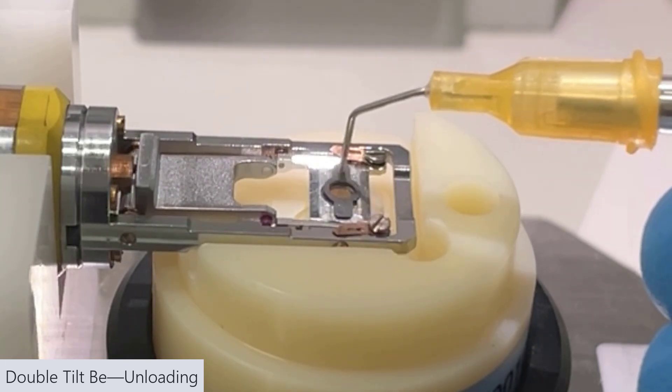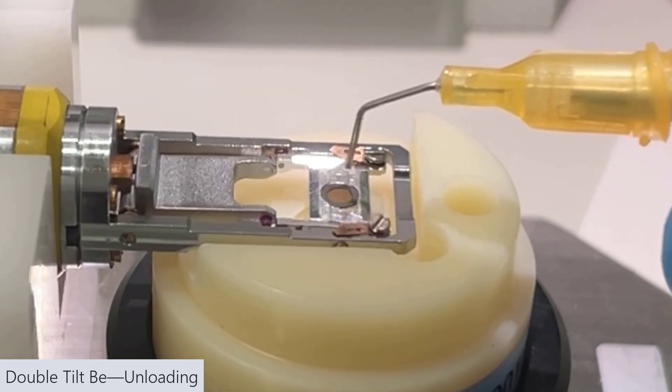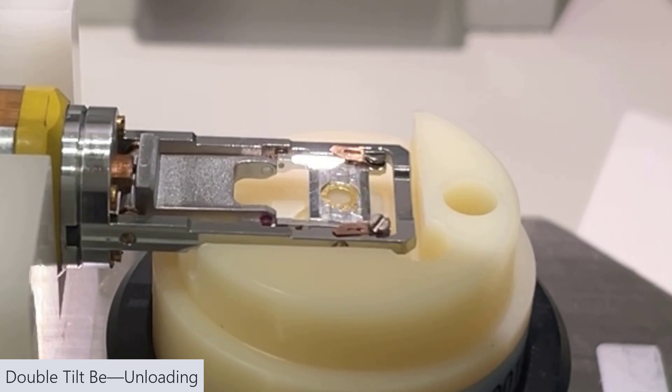Remove the beryllium cap, the beryllium spacer, and in this case, I accidentally grabbed the sample as well, so that's fine.